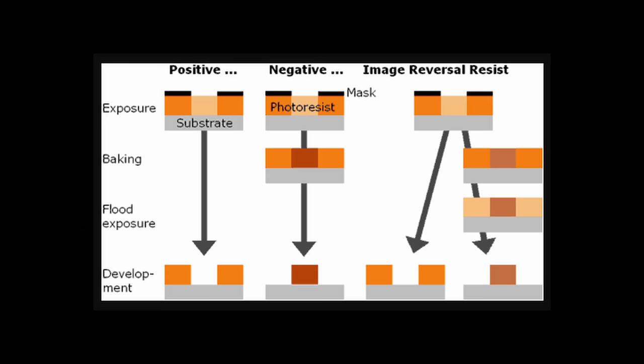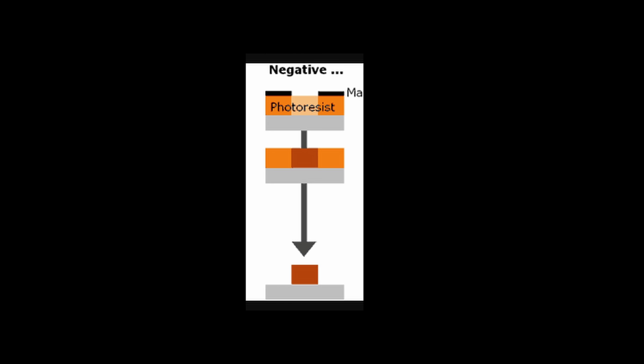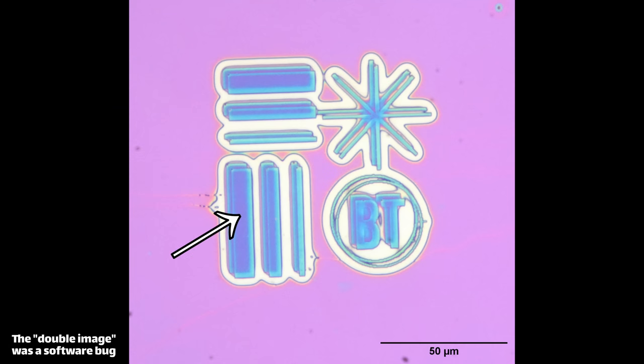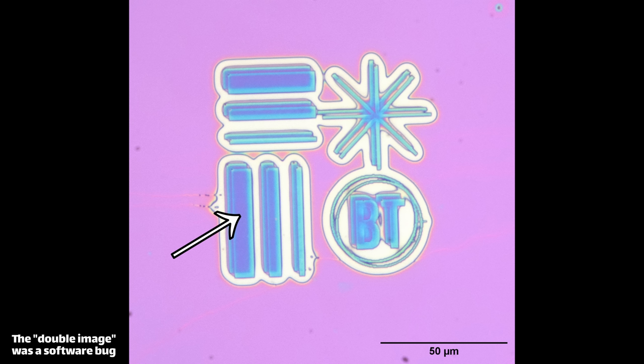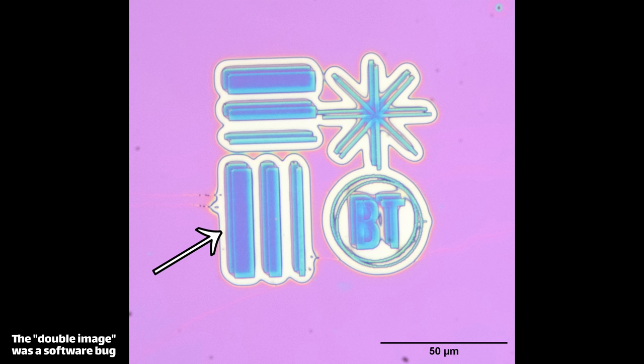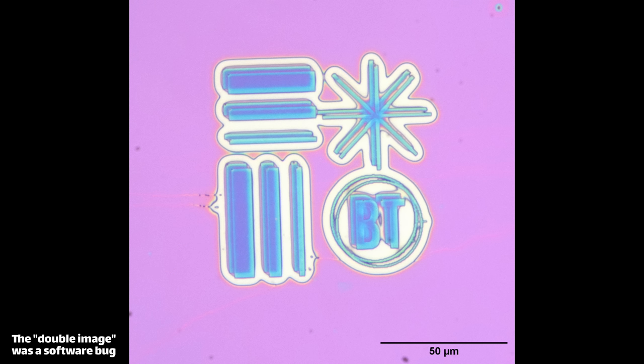There's one other big issue with PMMA: it can switch from a positive resist to a negative resist. Under a certain threshold it acts as positive — exposed areas wash away leaving holes. But if you overexpose it, the chopped-up polymers get pounded back together and become insoluble in the developer, so the exposed region stays behind while everything else dissolves — negative behavior. One of my test images shows this clearly: the overexposed pattern remained insoluble and stayed behind, while the surrounding region was exposed just enough by the proximity effect to dissolve away.